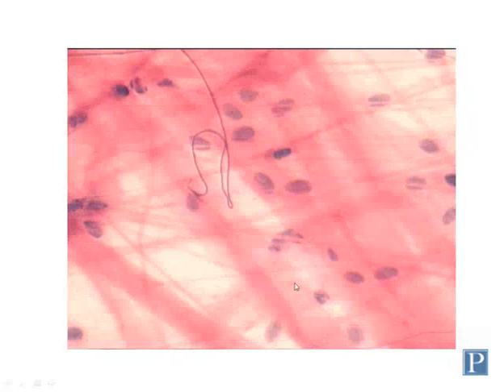Here's another section, a little bit higher magnification. Mostly you're seeing the type 1 collagen fibers here. Here's a single elastic fiber that's coiled around, and looks like a little thread or hair here. In areolar connective tissue, there's actually a third type of fiber, which are called reticular fibers.